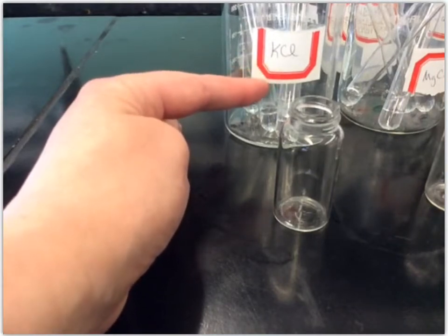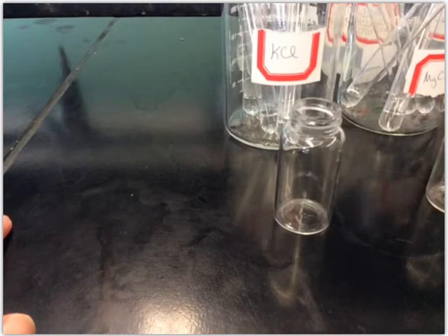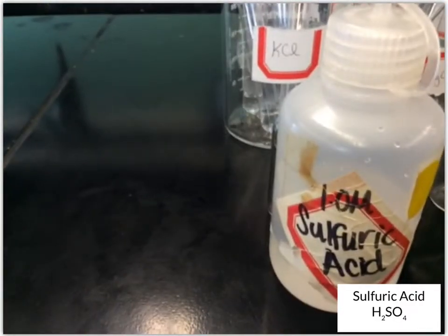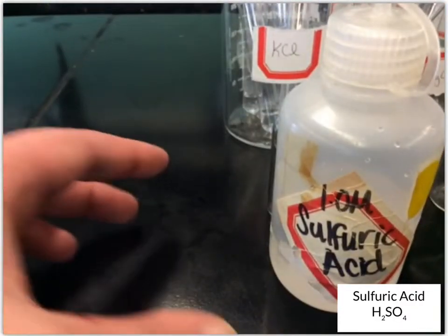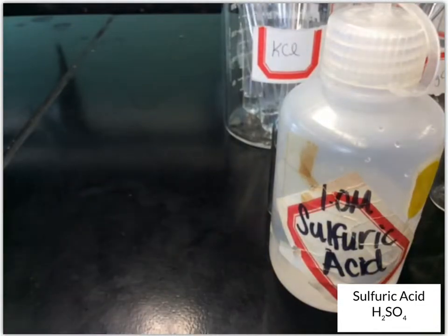We're going to run initially 4 tests to see how these substances interact with different acids and bases. The first one that we're going to do is with sulfuric acid. To each of our known substances, I'm going to add some sulfuric acid to the test tube and see if there's any changes.